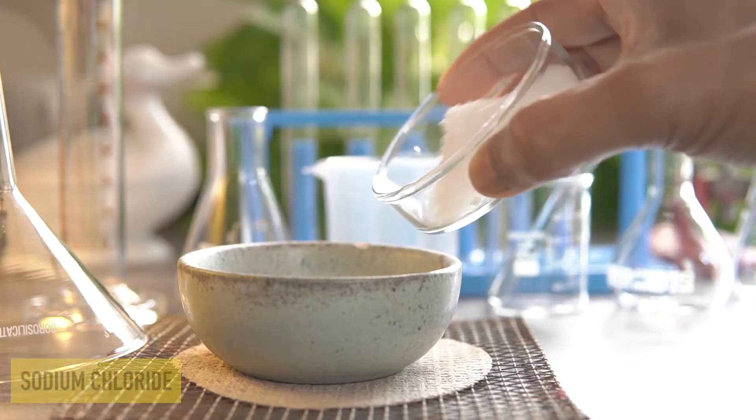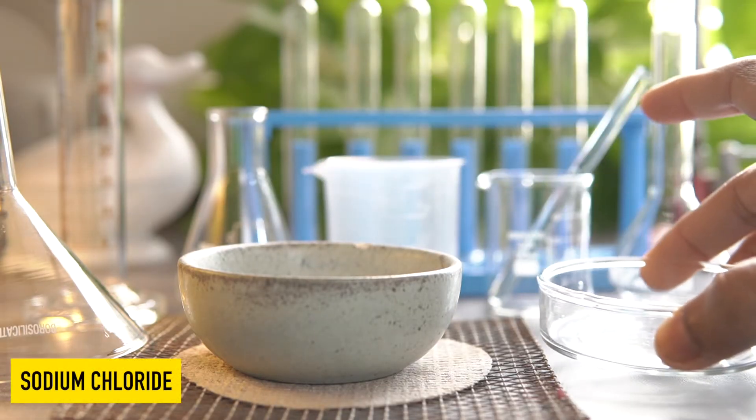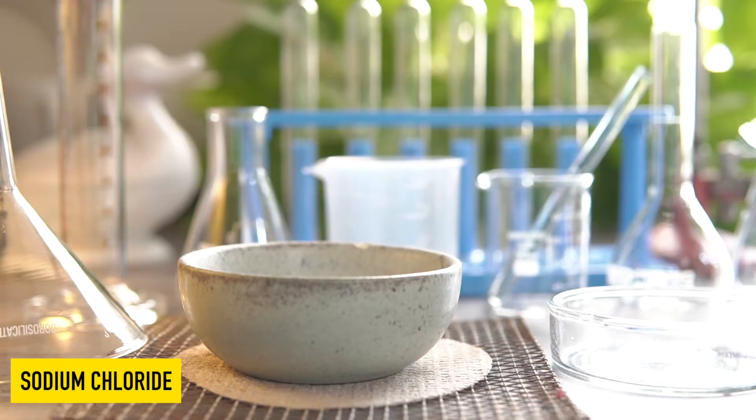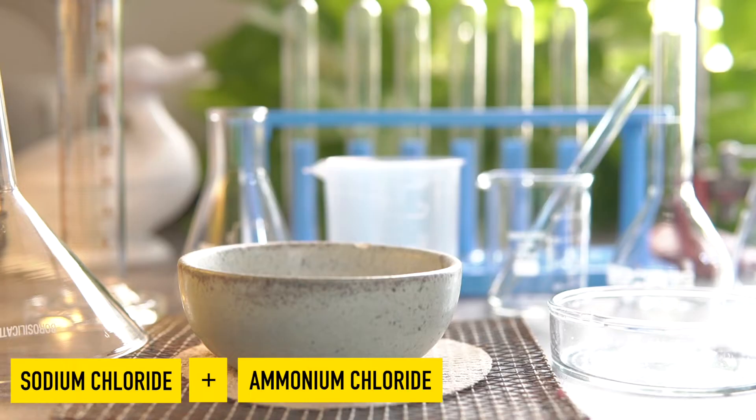At first we will keep sodium chloride salt and ammonium chloride in the evaporating dish and mix them thoroughly.